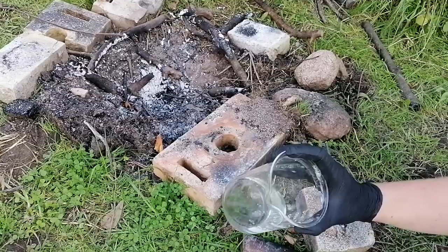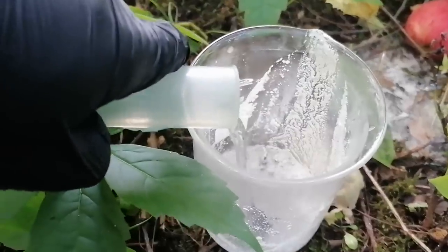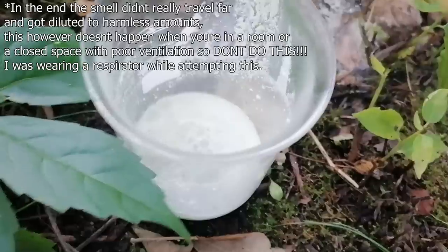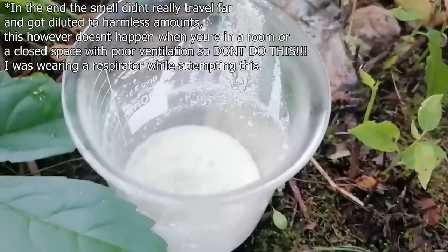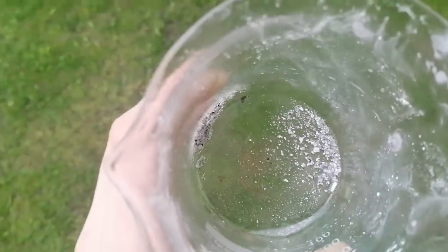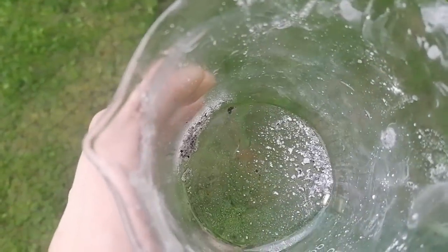I had to act fast, so I picked up all the slag into a beaker and went to a secluded location, where I added a bunch of hydrochloric acid. This put the hydrogen sulfide production into overdrive, which you can see by the bubbles produced. Sadly, while processing, the whole mix turned into a white mess, most likely due to silicic acid impurity. There was a little bit of a black spot which was silicon metal, but it was not worth trying to recover, so this batch was dismissed.